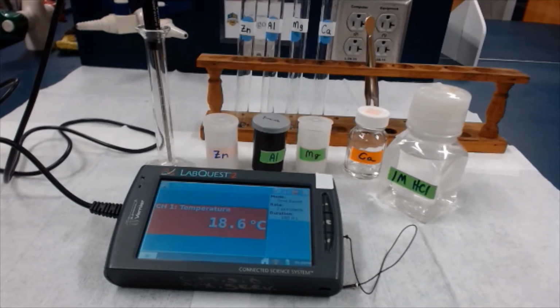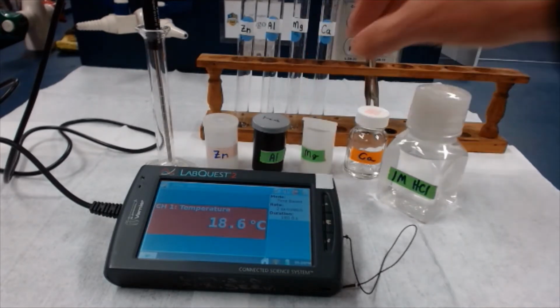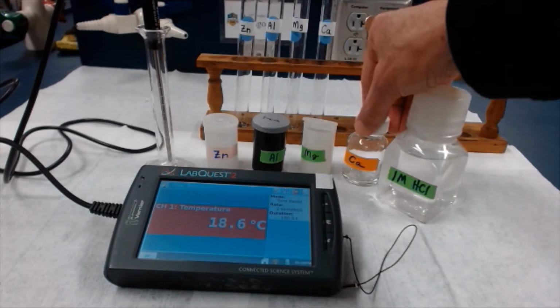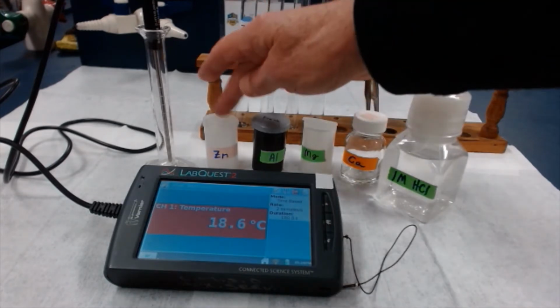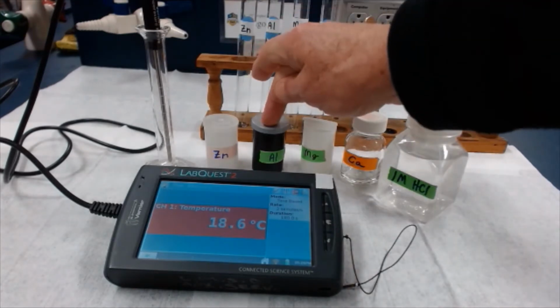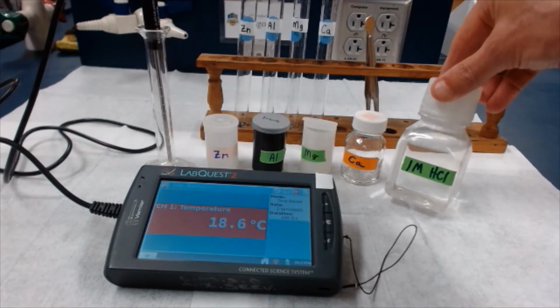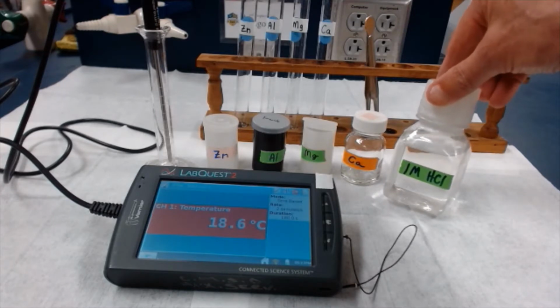All right, so here's what we need. As usual, let's assemble our materials. Well, we need some magnesium ribbon. I have a little container here. Some calcium lumps. Need some zinc foil, and again it's inside this little container, and some aluminum foil. I need some hydrochloric acid. The concentration is called 1 molar, 1 M. It tells how strong the acid is. It's actually not a very strong concentration of hydrochloric acid.